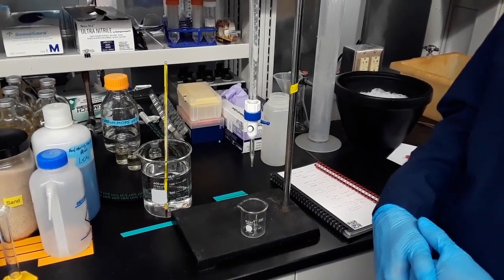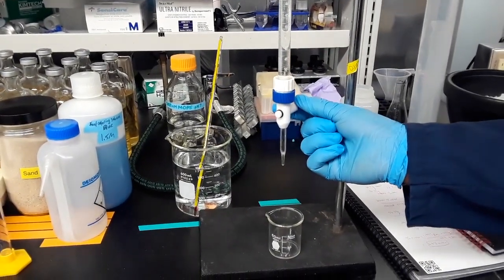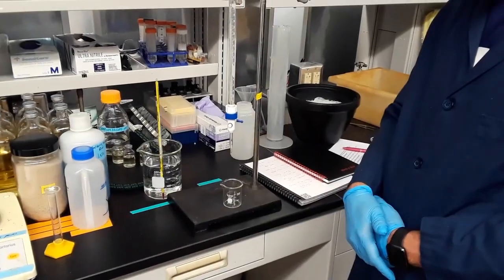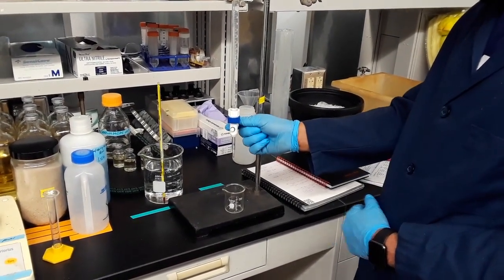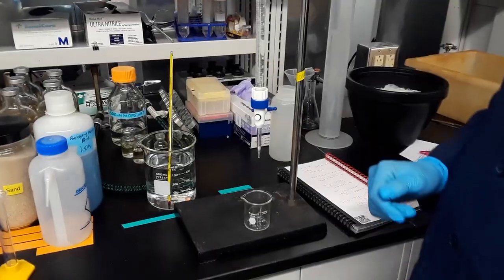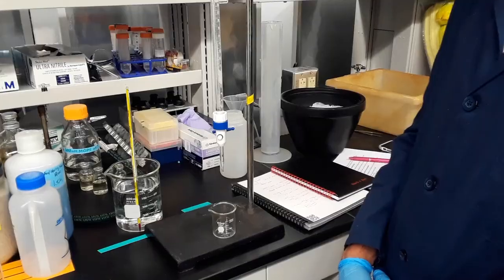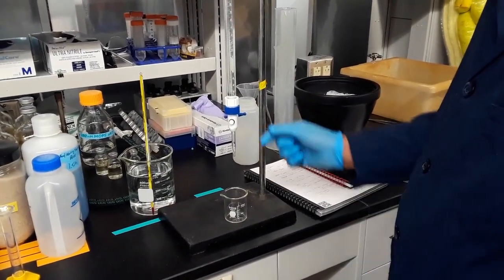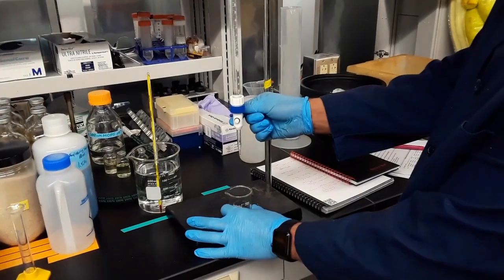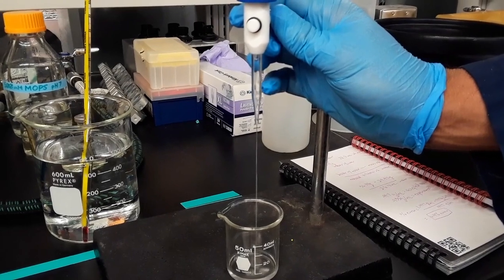So the way that we dispense the water from the glass burette is using this thing called a stopcock. And so what you will do is you will grab the stopcock. So the way to dispense water from the glass burette is using the stopcock. So what we're going to do is we're going to turn the stopcock slightly to the right, and we're going to slowly dispense the water.